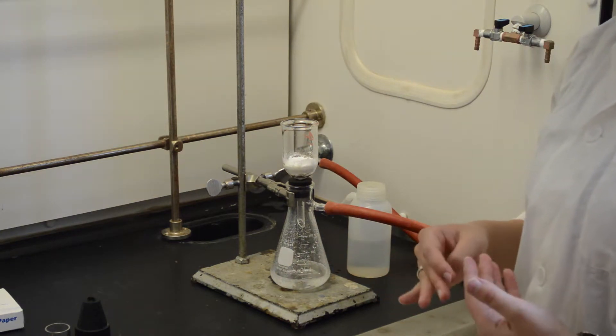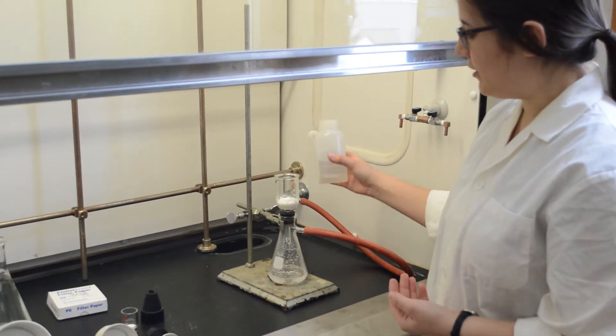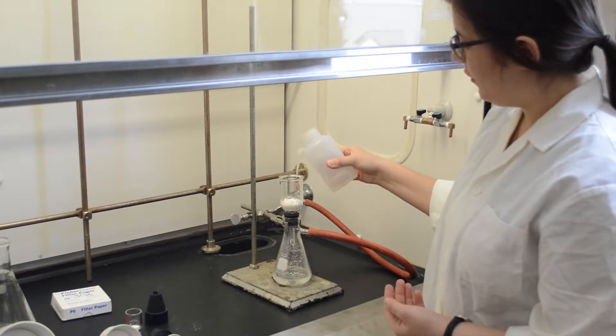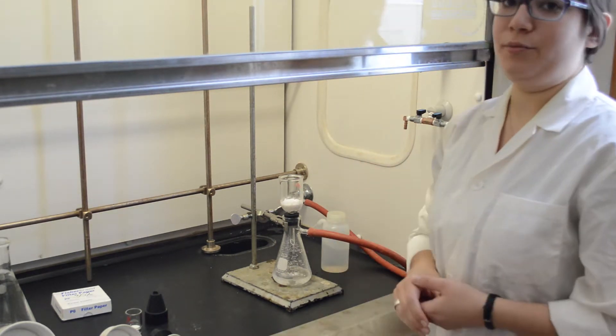Next you can rinse your solid with a few washes of whatever your solvent is. In this case it's just some distilled water. And then allow it to vacuum dry.